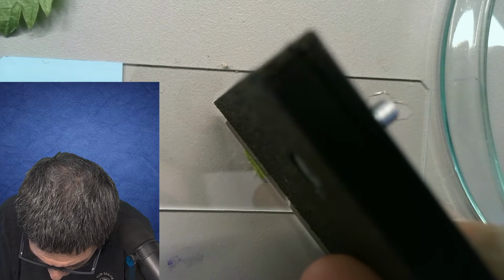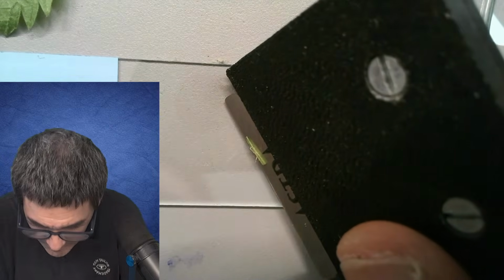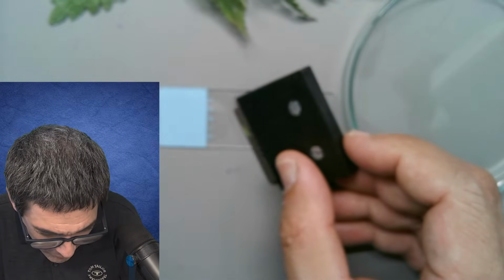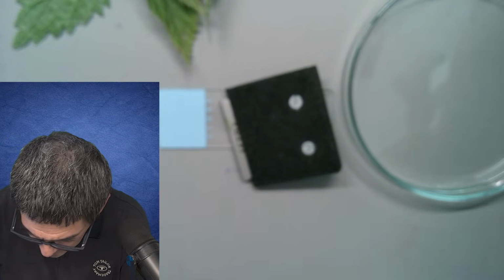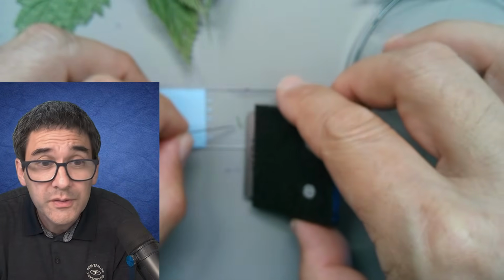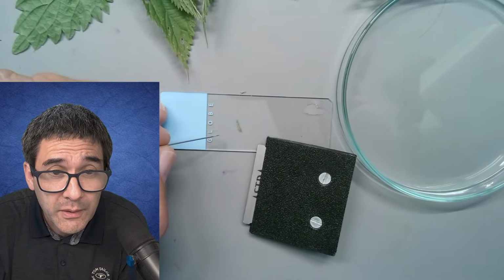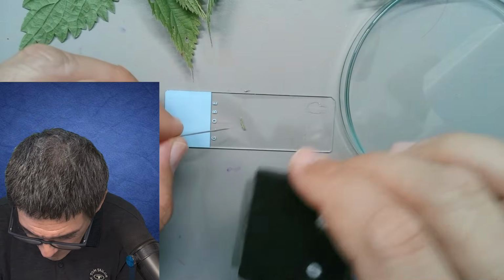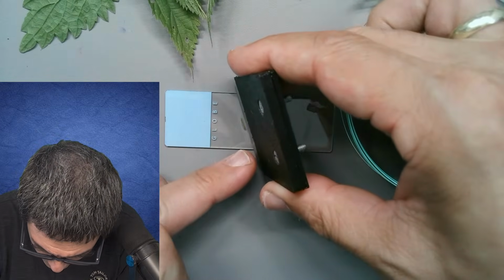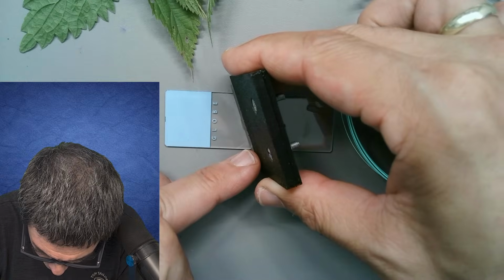I'm going to maybe try to cut it longitudinally. Okay, and then hope for the best. Here we go. I was looking for my needle again, and I misplaced the needle. Here it is, over here. Okay. Ooh, it's out of focus. Bad. I don't know if this is actually thin enough. I see I kind of cut the stem not longitudinally, because it was too difficult for me.